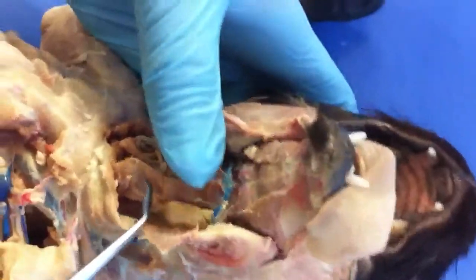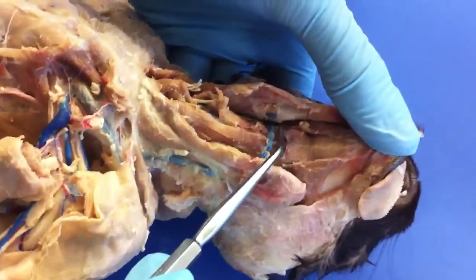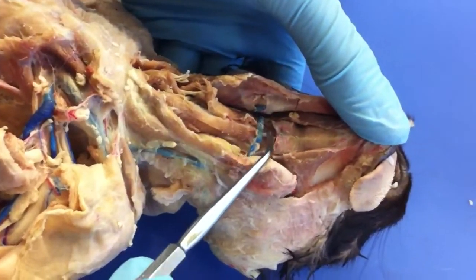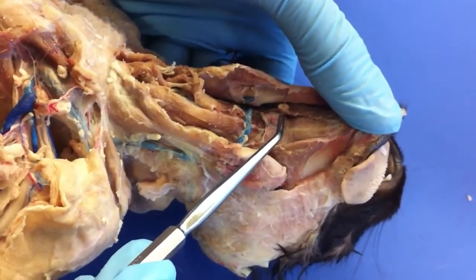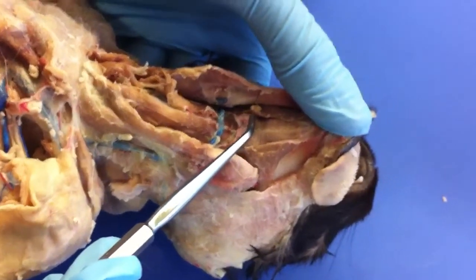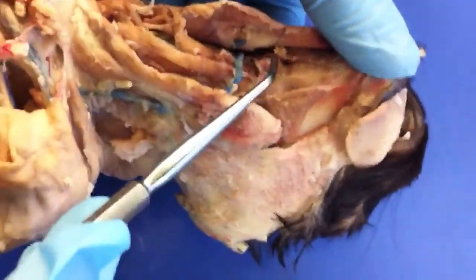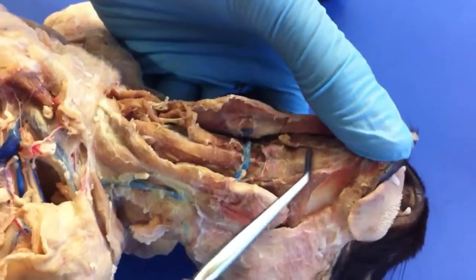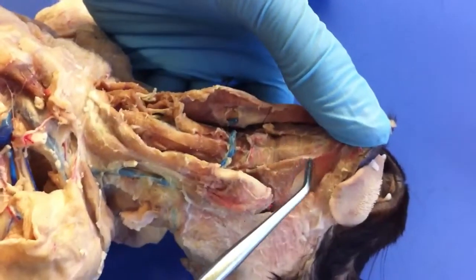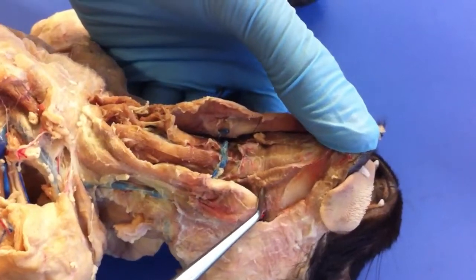And then right above that, we have the geniohyoid, which is right there. And then running perpendicular to those, we have the mylohyoid, which runs perpendicular. And then the V-shaped paired jaw muscles right there is the digastric.